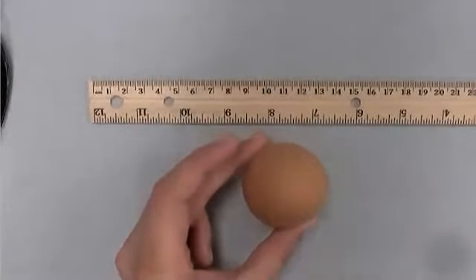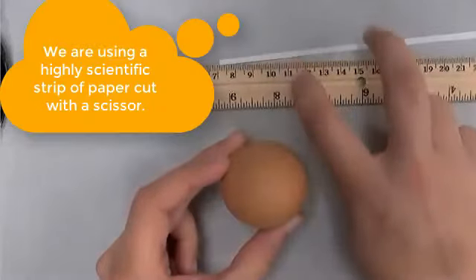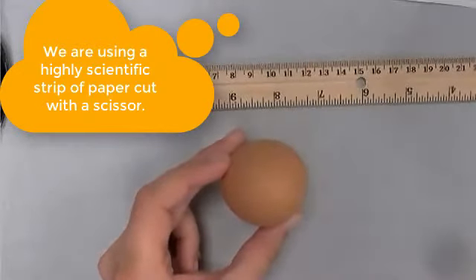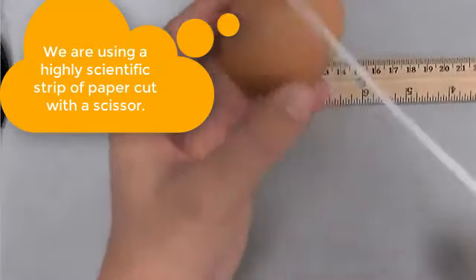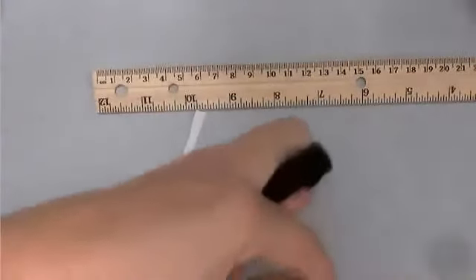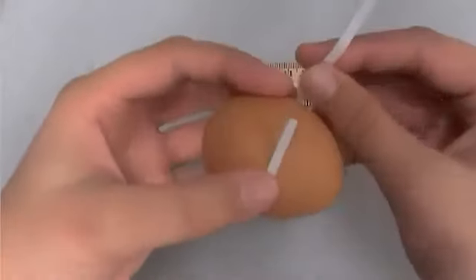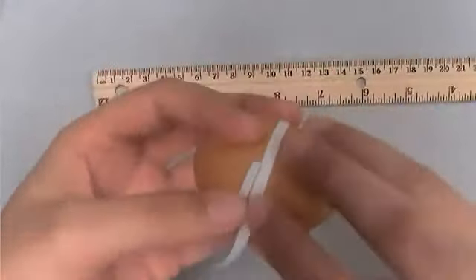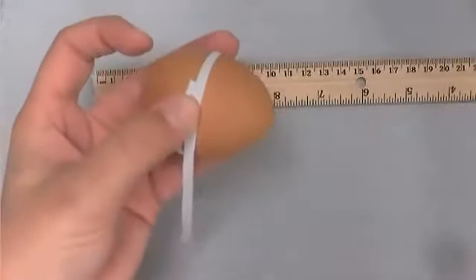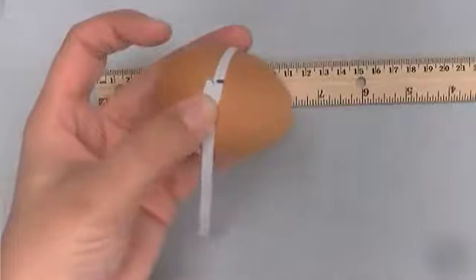The way that we're going to do this is you can do this with either a string or a piece of paper. Here's a string that we worked out, which is basically just a cut piece of paper. You need that, and you need something to put a little mark on the paper. So we're going to find the widest point of the egg, and we are going to wrap our string around, and where the two ends come together, make a mark.